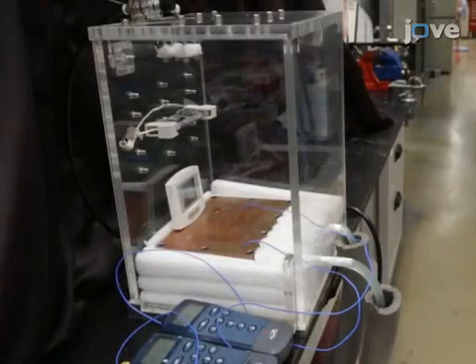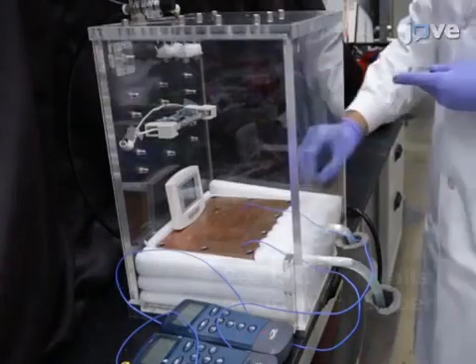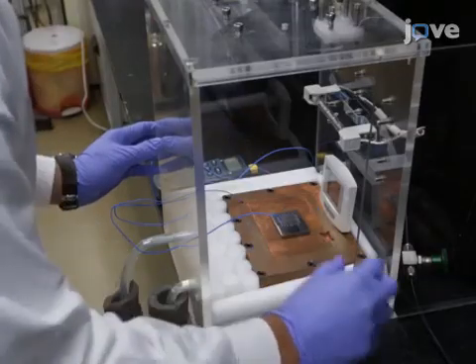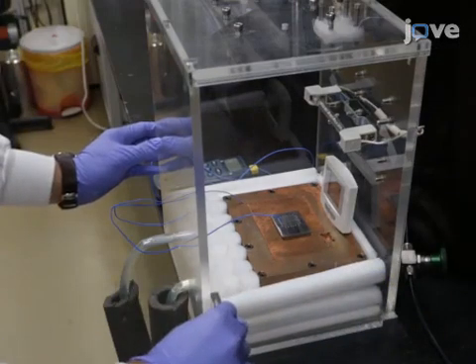To begin this procedure, open the door of a drying chamber and immediately place a previously cleaned sample plate on the copper base block. Then close the door.